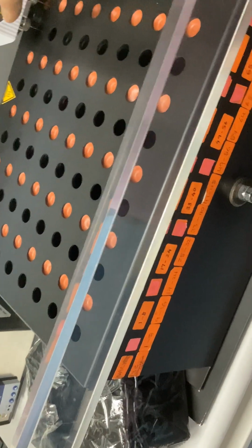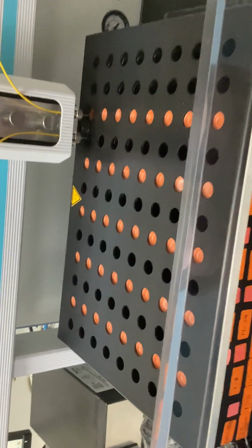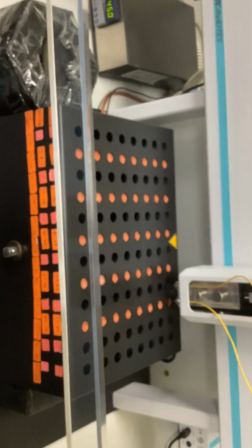So when you're doing flushing, you put the flushing needle here and the analysis needle here. No, we don't do any change. We don't interchange any needle positions here. We just take care by placing the tubes in such a way that we are not at any risk or any loss.